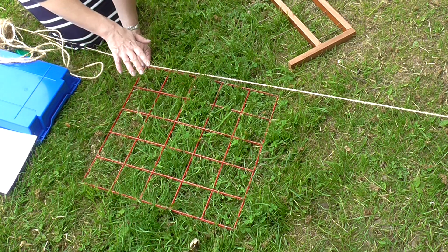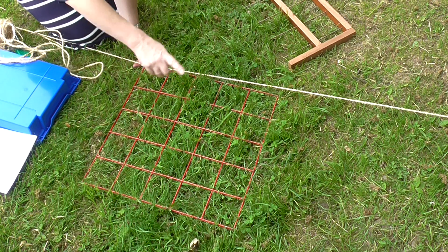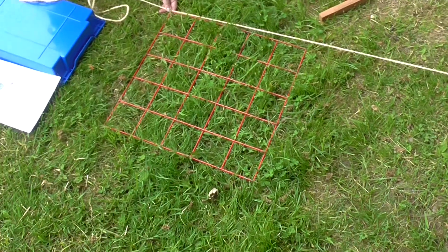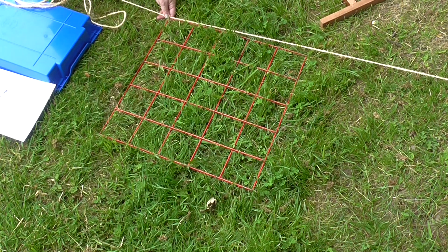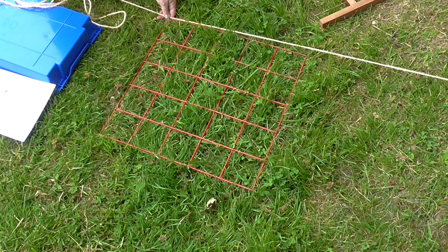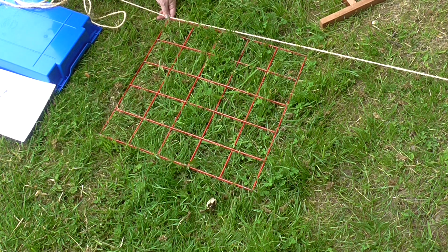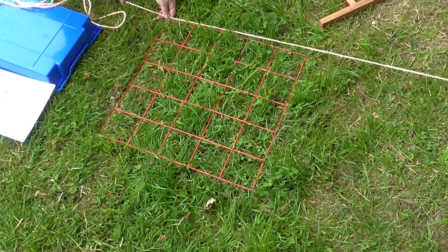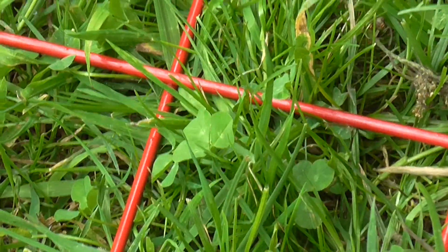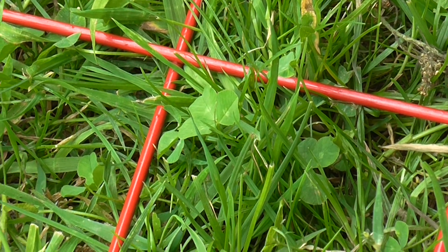Multiply by 100 and you've got your percentage covered by clover. This is a little bit subjective because you've got to decide whether a square with maybe just one little bit in there contains clover or not. Here I've counted up and found that 17 out of 20 squares contain clover. So 17 divided by 20, multiplied by 100, gives you your percentage cover. Obviously you need to be recording this in your results table.